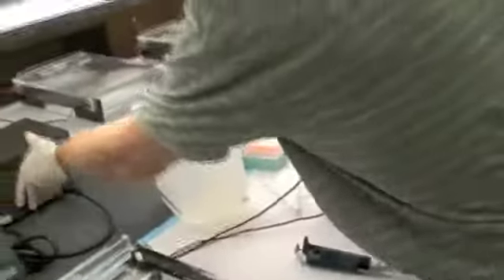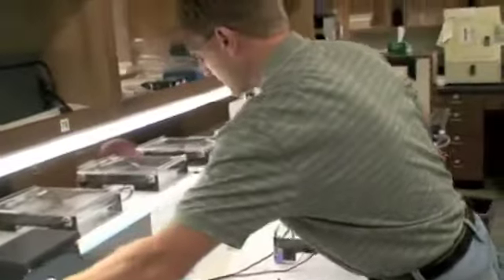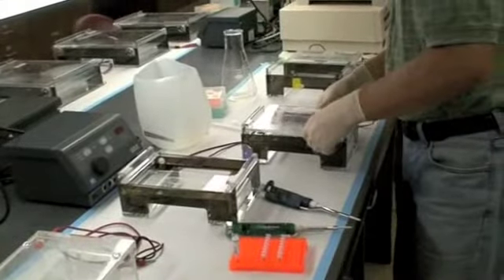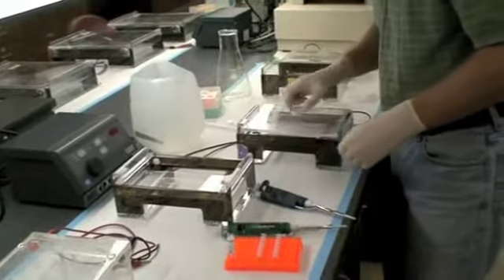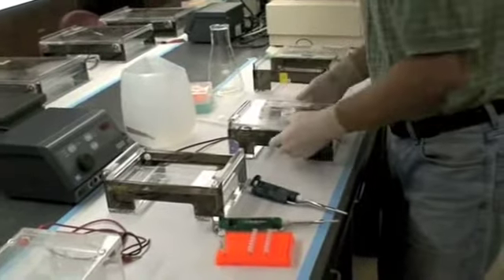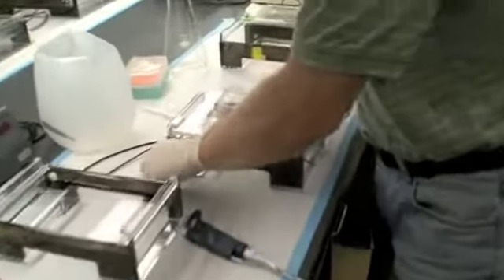Once we load, so this is the lid that we use when the electrodes are turned on. And here's the power supply. What I can do is once this is on, or even after it's running, I can just make sure that it's balanced.